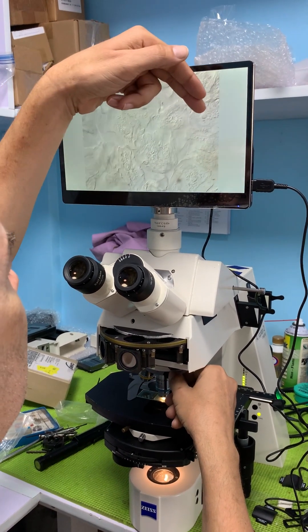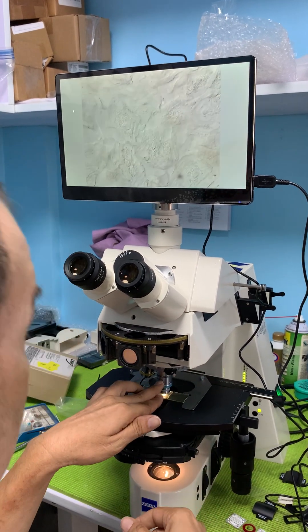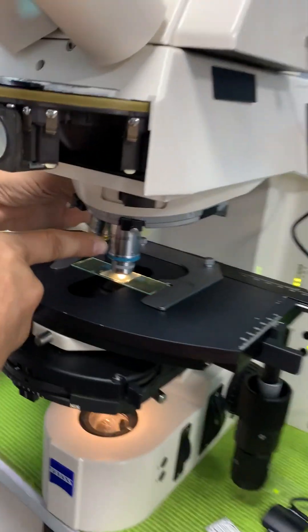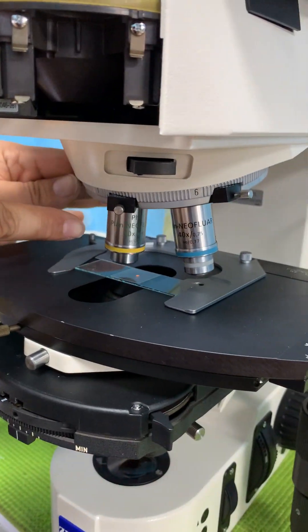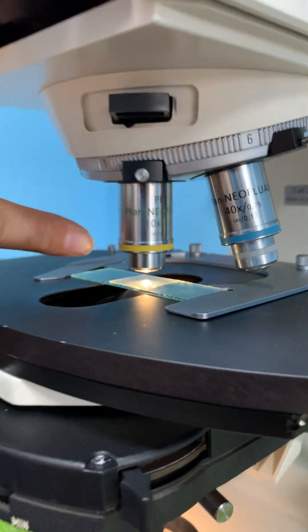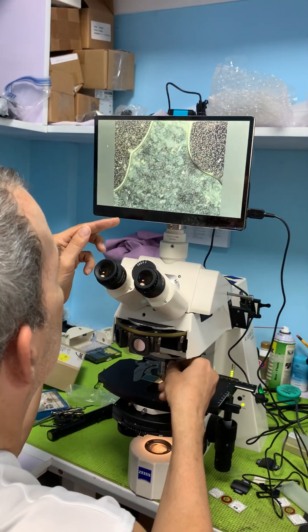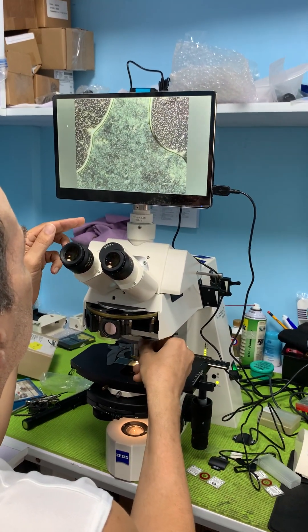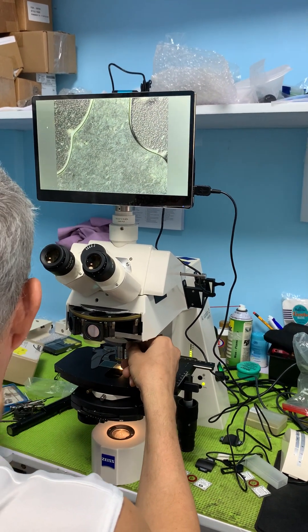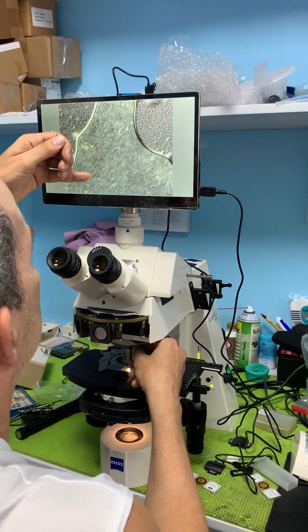The nuclei are coming out a bit more at me. Now let's change from the 40x Plan Neofluor to a 10x Plan Neofluor — this one also happens to be a phase objective. The nuclei are really tiny now because we're at 10 power.